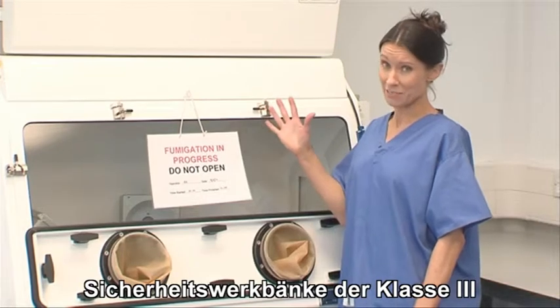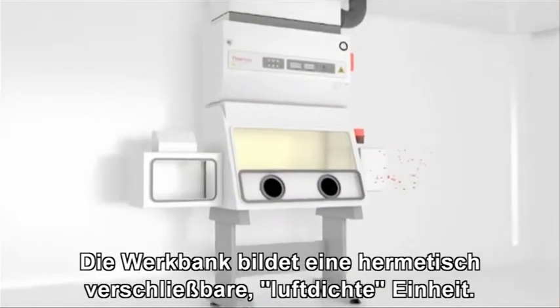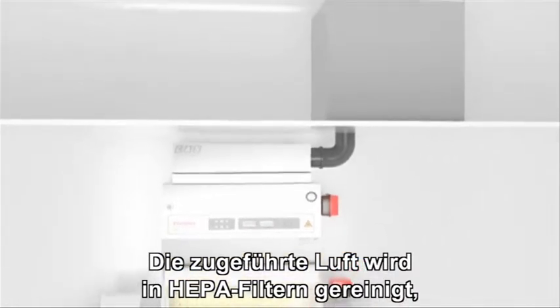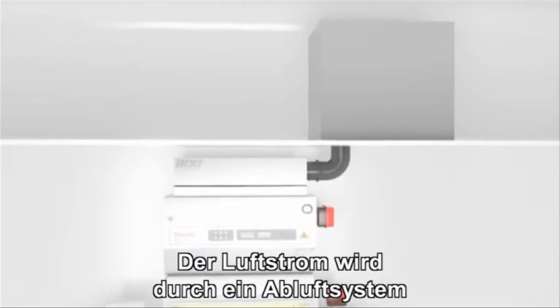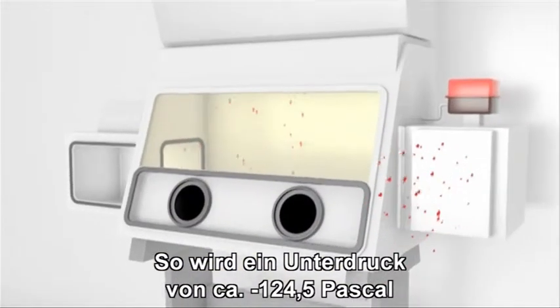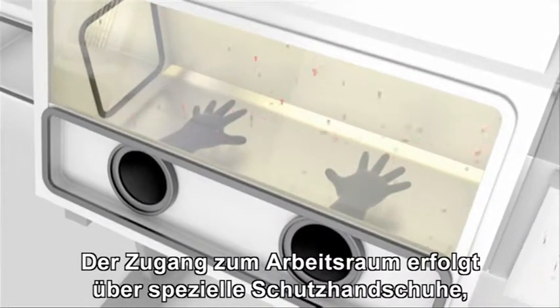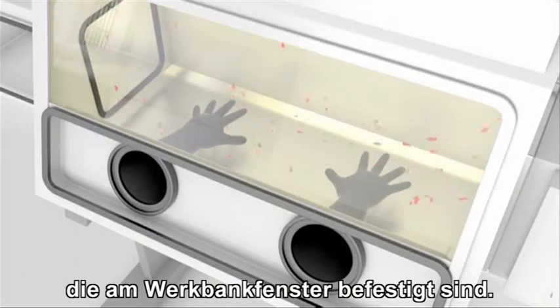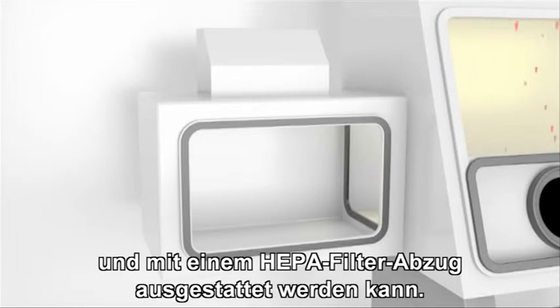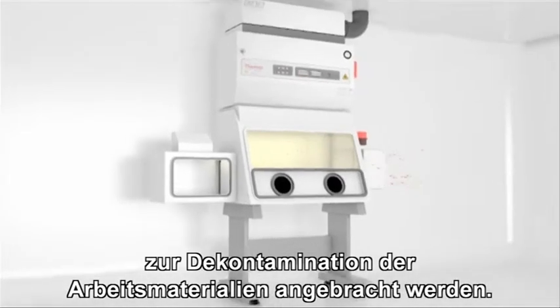The Class 3 biological safety cabinet provides the highest level of protection for personnel and the environment. The cabinet itself is a completely sealed, airtight unit. The air supply is HEPA filtered and the exhaust air passes through 2 HEPA filters. Airflow is maintained by a dedicated exhaust system outside of the cabinet, which keeps the cabinet interior under negative pressure, around 124.5 pascals. Access to the work surface is by means of heavy-duty rubber gloves attached to ports in the cabinet door. The Class 3 cabinet has a pass-through box attached that can be sterilised and equipped with a HEPA-filtered exhaust, or a double-door autoclave can be connected for the decontamination of all materials entering or exiting the cabinet.